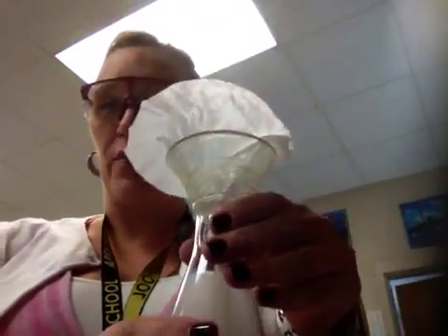It actually turns into this. What's happened here is that this white substance has settled to the bottom of the test tube, and the top of it is the clear liquid. This white substance is a solid. Any time you get a solid product from a double displacement reaction, that's going to be a precipitate. I know it's a precipitate because I filtered it and let it dry overnight.